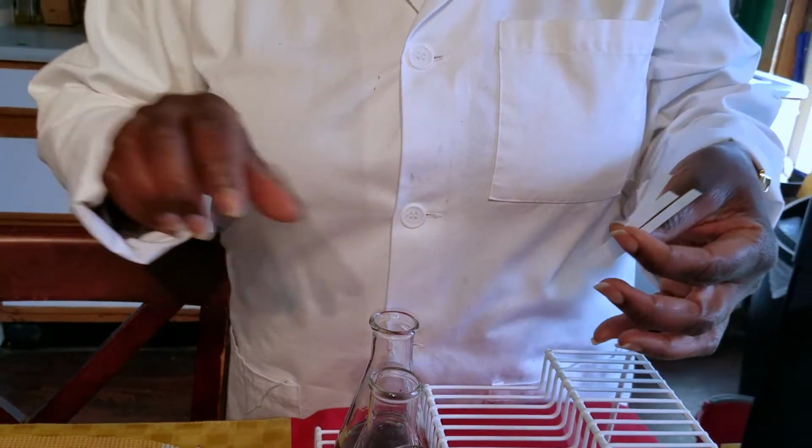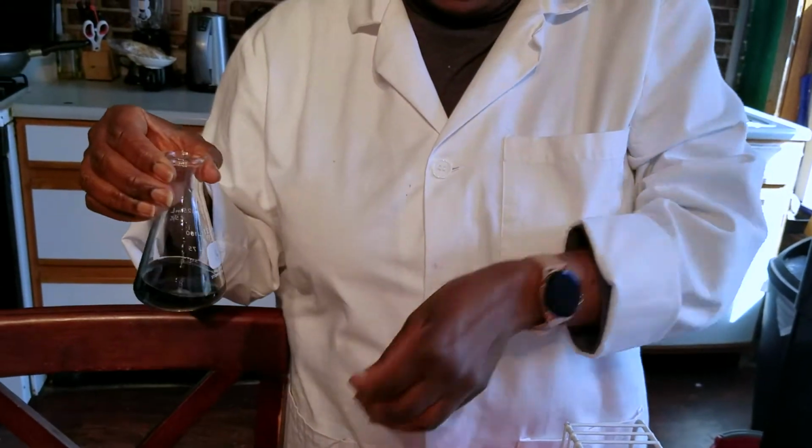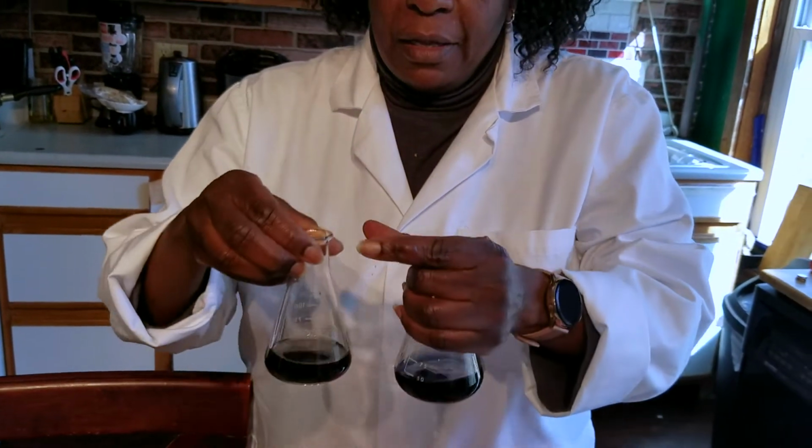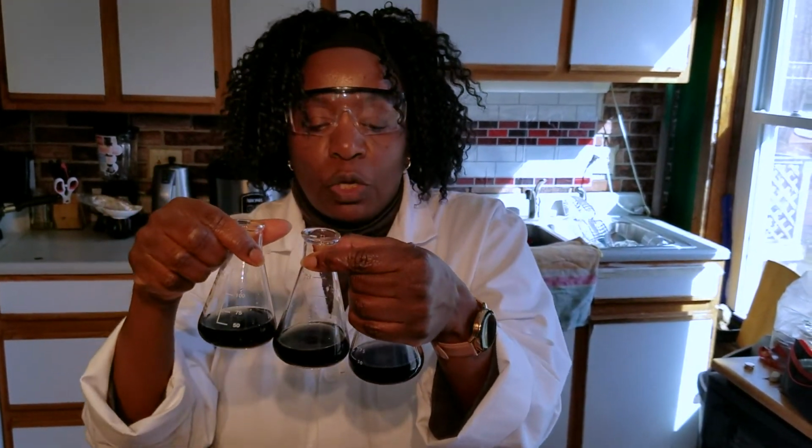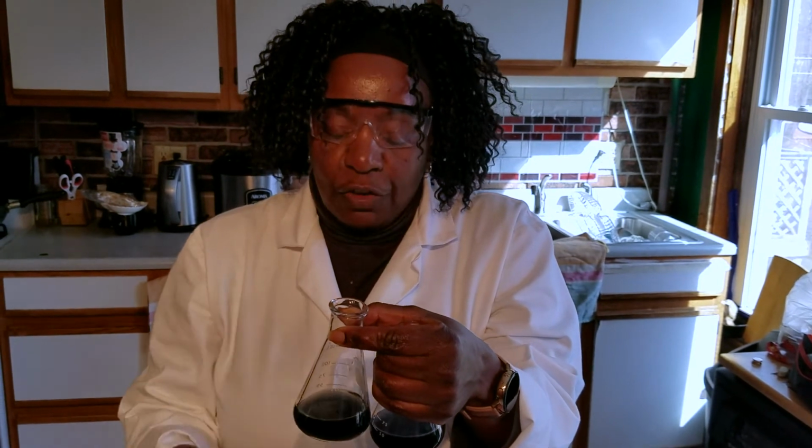So, summary, we took 10 milliliters of acid, added a certain amount of base to be able to come up with this final change. For the second part of class, we're going to do the calculations.